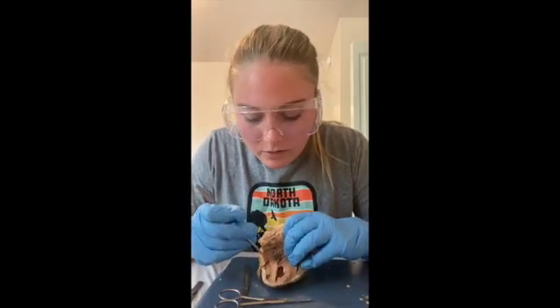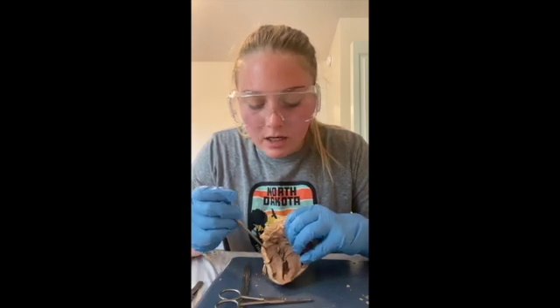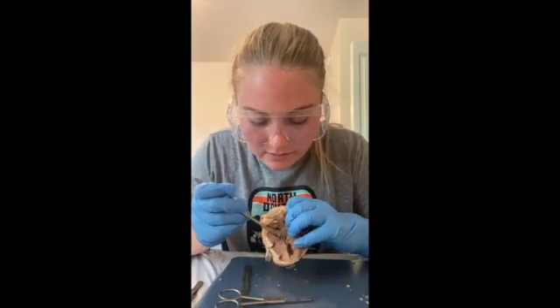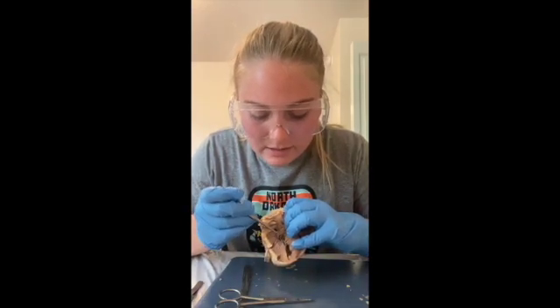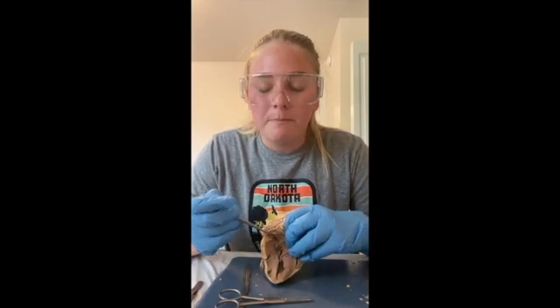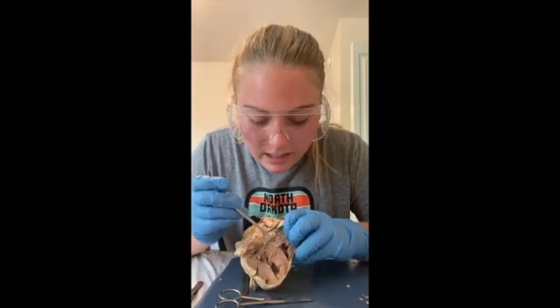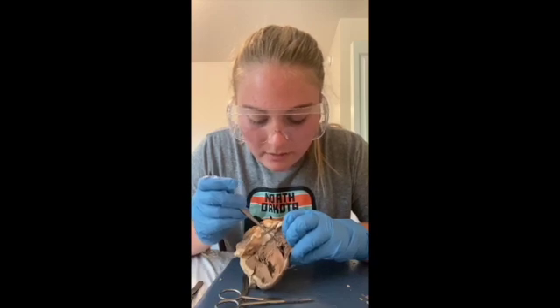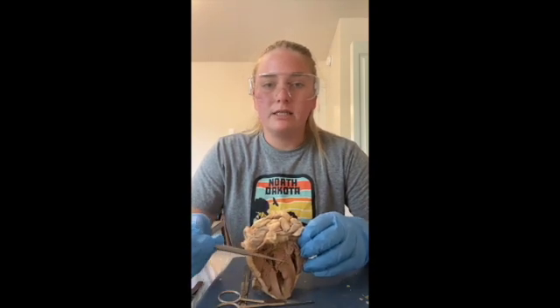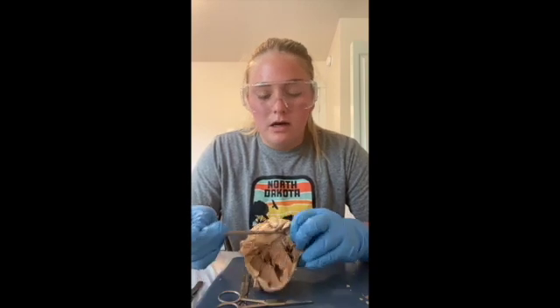And so what separates these two, the ventricles and the atriums, are cusps. So on the right side, we have the tricuspid valve. It's an AV valve. As you can see, it has those three little bands. And so this just helps prevent backflow into the right atrium. And then same thing over here, we have the bicuspid valve, and it kind of got cut apart in my lack of dissecting abilities. But same thing, it separates the ventricle and the atrium on the left side here, and it just prevents backflow to the left side.